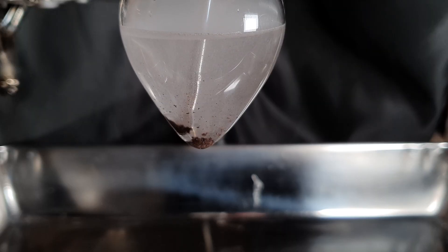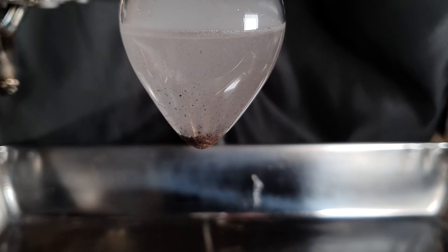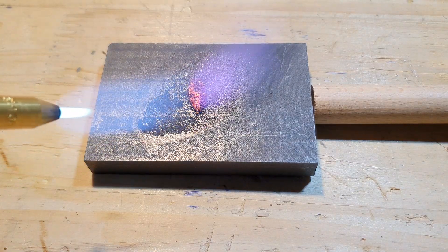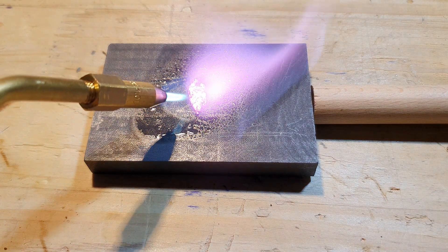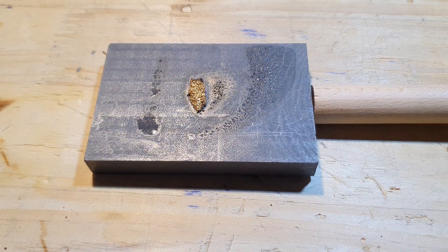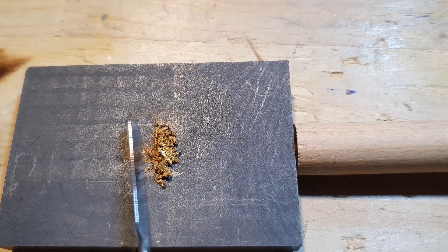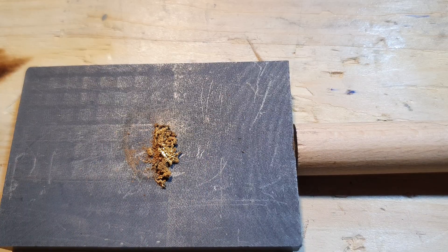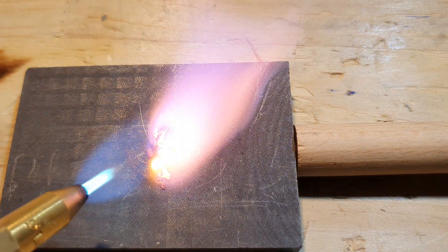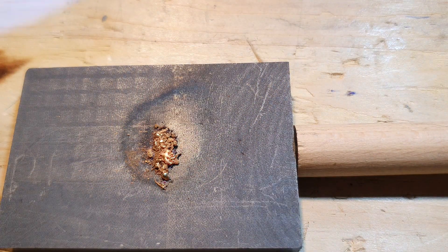The gold that formed was a brown powder. I washed it with distilled water and melted it into a small piece of gold. While watching me melt the gold, let's talk about how to improve the synthesis. The particle size of the gold is definitely more crucial than I had hoped. For the next attempt I will dissolve the gold as chloroauric acid and reduce it using sodium sulfite or oxalic acid to create a gold powder with a very high surface area. I will also increase the diameter of the tube containing the gold to ensure all of it contacts the cesium, and may add a glass stir bar to agitate the gold.